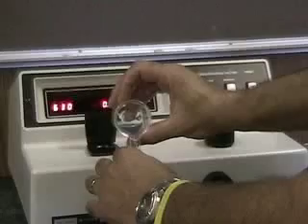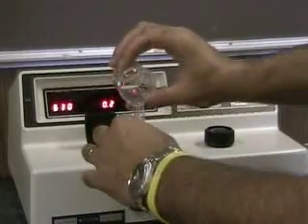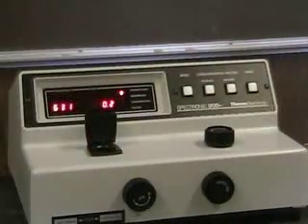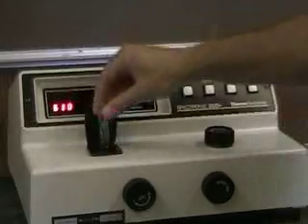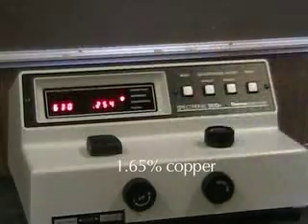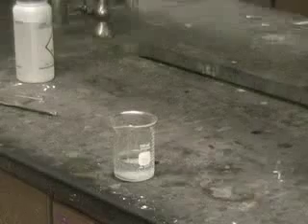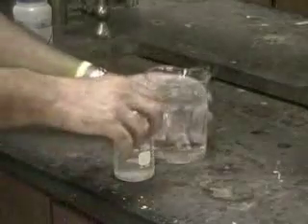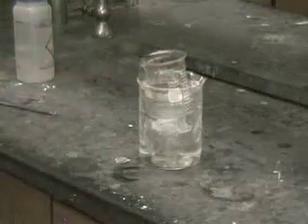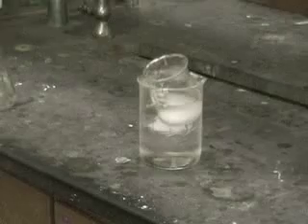We measure the absorbance of our sample and compare it to a standard curve to determine the percent copper in our sample. We redissolve the remaining solid and begin cooling that sample to recrystallize the solution. A precipitate will form again, but of much greater purity than our first crystallization.